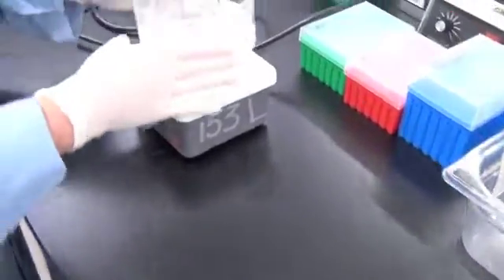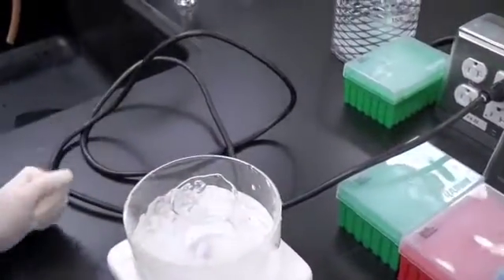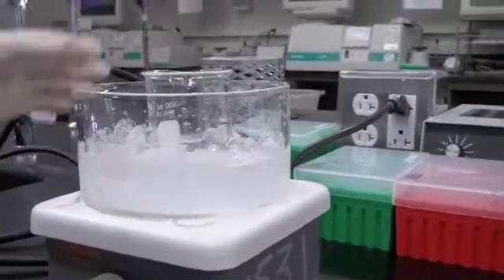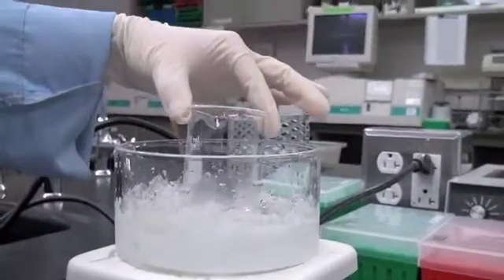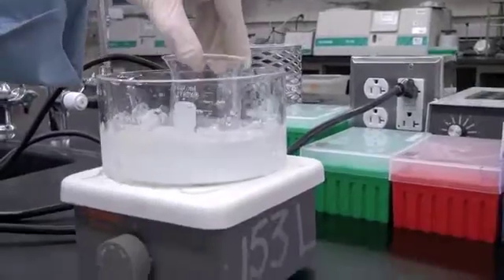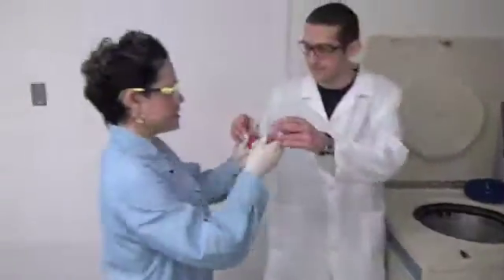Look how Biochemist Dicer has properly set up her filter. Also, she has prepared her salting out glassware with a wet ice bath and a beaker placed in the middle with a clean magnetic stir bar. Are you thinking what I'm thinking? Margaritas! Woohoo! And the spin is complete. Biochemist Dicer has quickly obtained her samples.